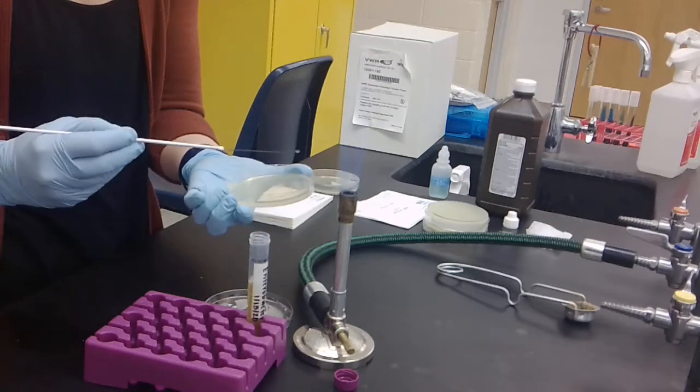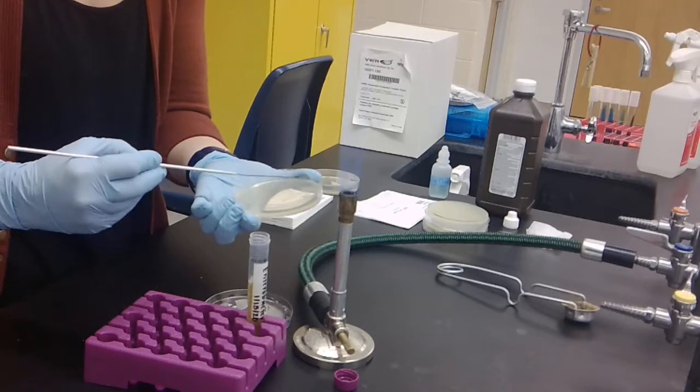You are then going to carefully transfer them onto the agar plate, like you've done with a plate transfer before.